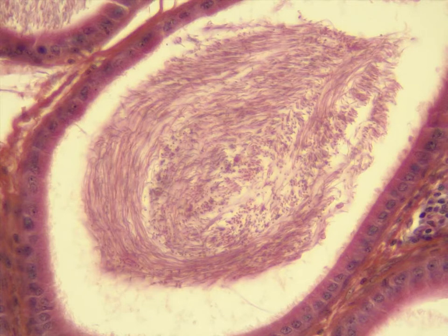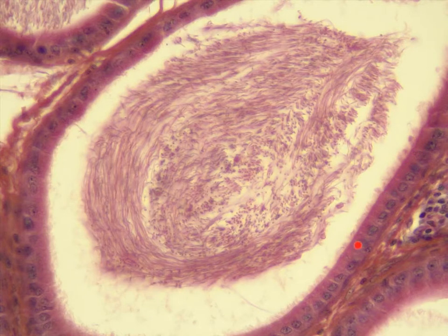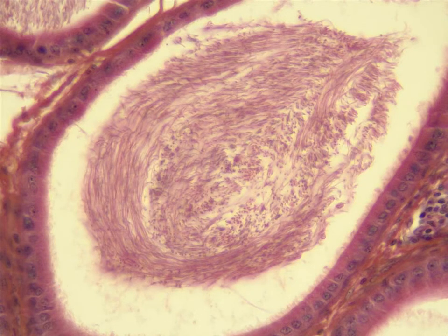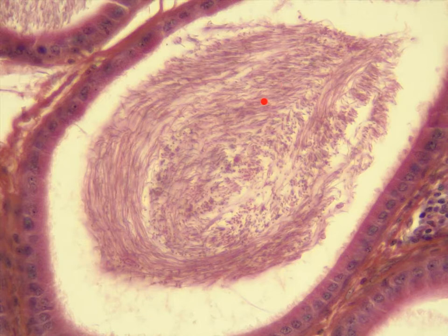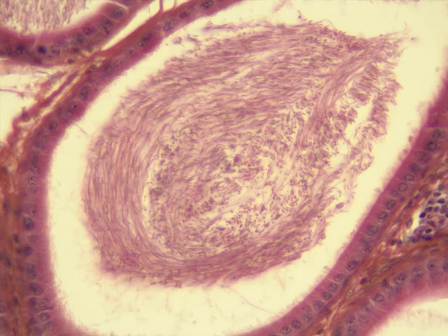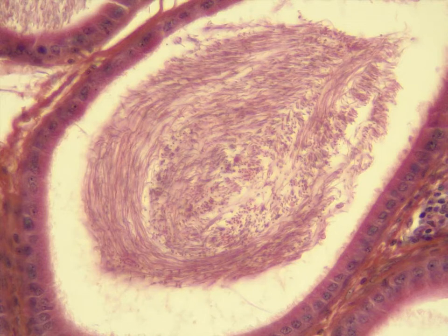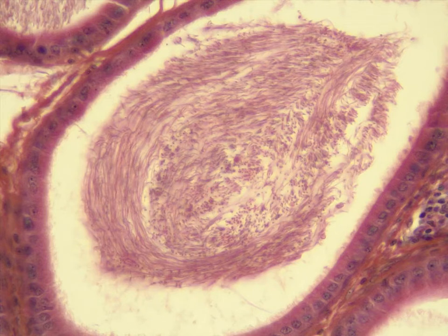Zoomed in on the epididymis, you can see that the cells lining it are much thinner and there's a lot less going on. Most of the sperm are hanging out in the middle — you can still see their tails and their little heads. As they mature here they gain a better shape and a better swimming capability.